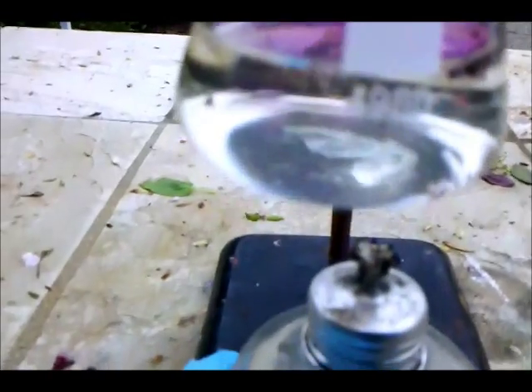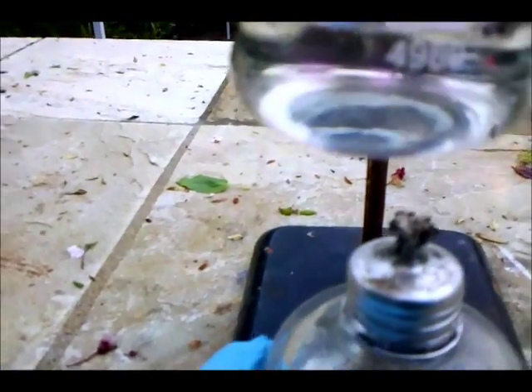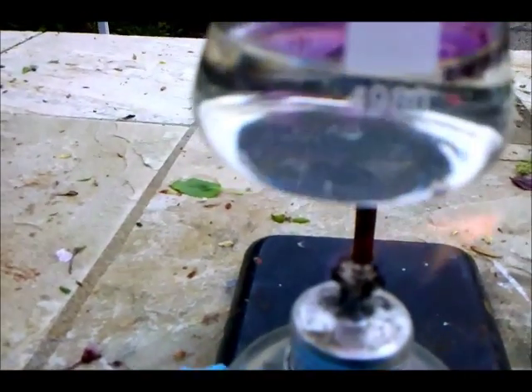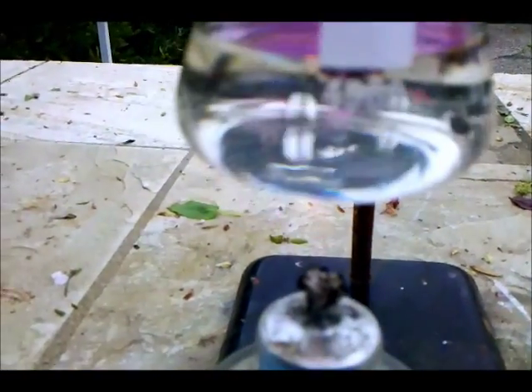To get around this you can put a reflux condenser up there and then scrape it back down periodically, or you can just accept the loss of yield. If the vapor gets too much I will put a beaker on top of there to collect the iodine. But for now just continue to boil the solution and add iodine until it stops dissolving.